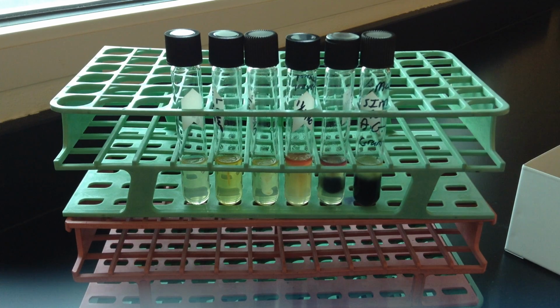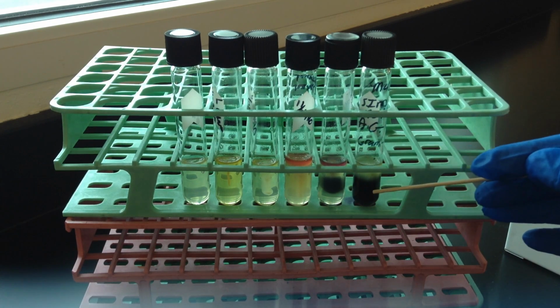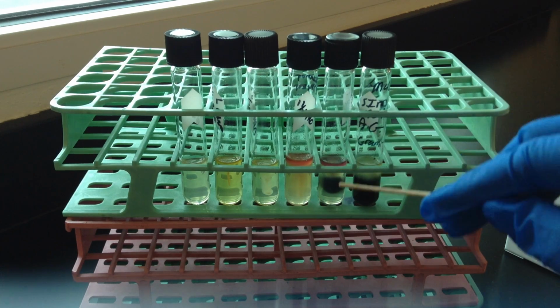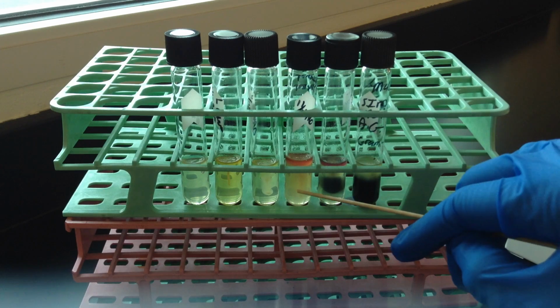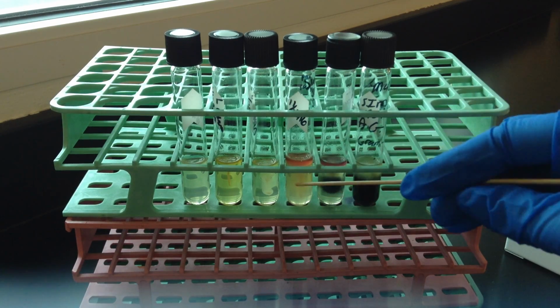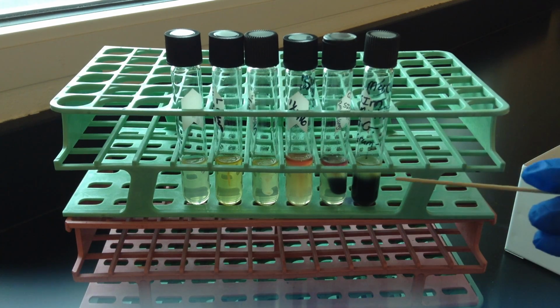So, three pieces of information just to quickly review in SIM. We've got the sulfur production, which can be from the enzyme cysteine desulfhydrase or thiosulfate reductase. We have indole production, which indicates the organism has the enzyme tryptophanase. And we have the motility piece, and so you can see on this one you just have that cloudy in all directions. Again, always have to turn that, preferably by a good light source. And then you have the black formation, which is associated with motility as well.